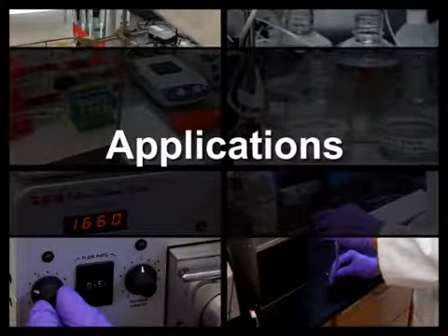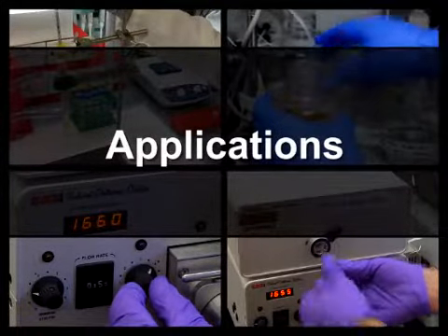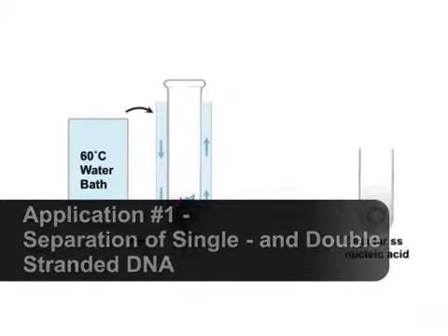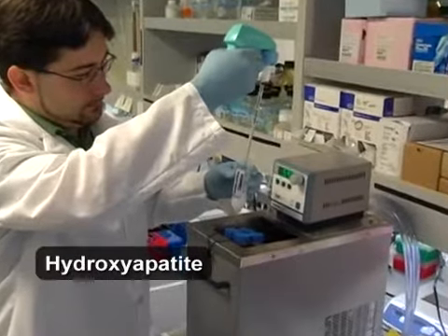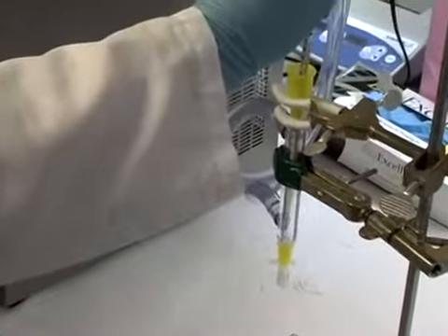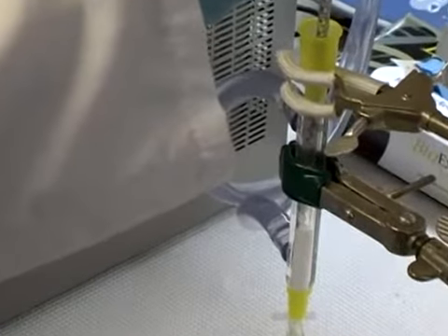There are many forms of liquid chromatography, each with different abilities to separate components of a mixture. In this example, column chromatography was used to separate a mixture of single and double-stranded DNA. Hydroxyapatite, or HA, is a crystalline form of calcium phosphate commonly used as a stationary phase due to its positively charged calcium ions.